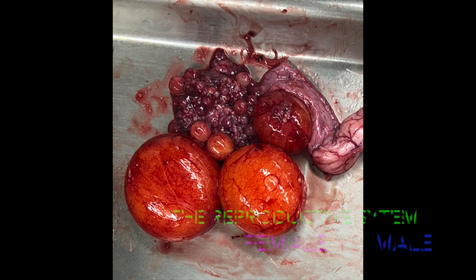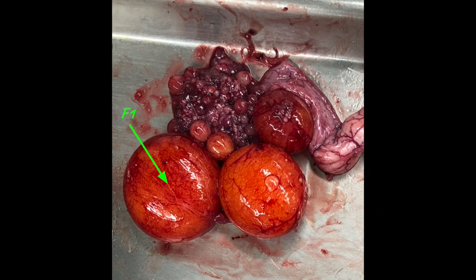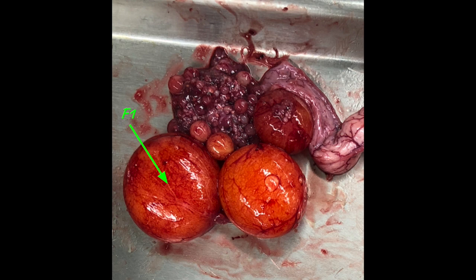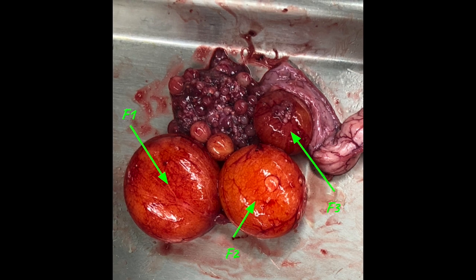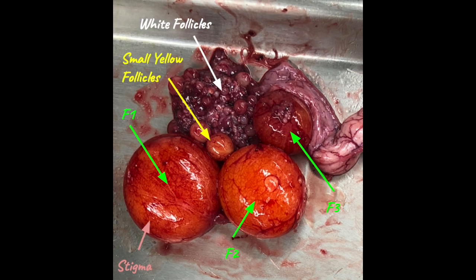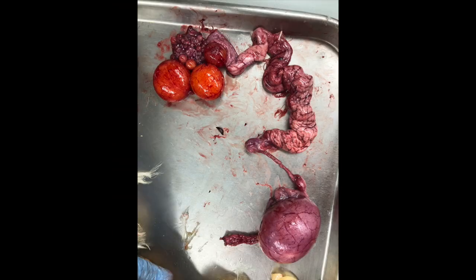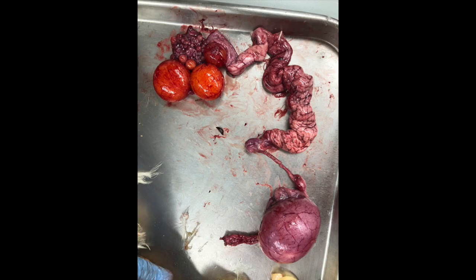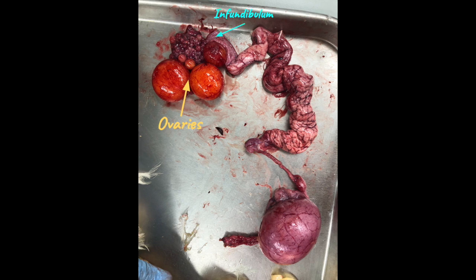Helena the hen is finally of reproductive age and consistently lays an egg a day. In birds, only the left ovary and oviduct continue to develop after the embryonic stage. Large yellow, small yellow, and white follicles are present. The large yellow follicles have a stigma — the site of follicular rupture after ovulation.